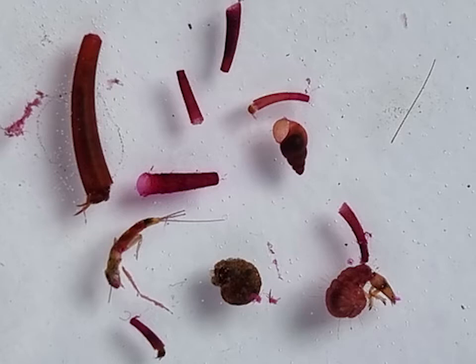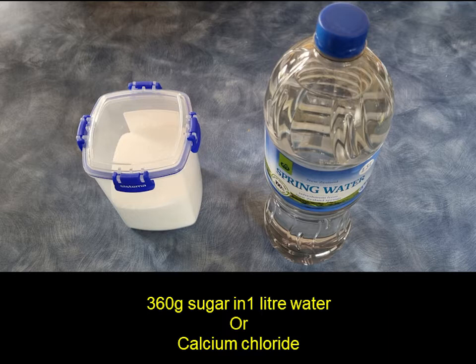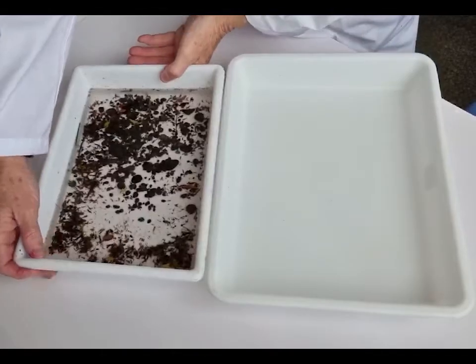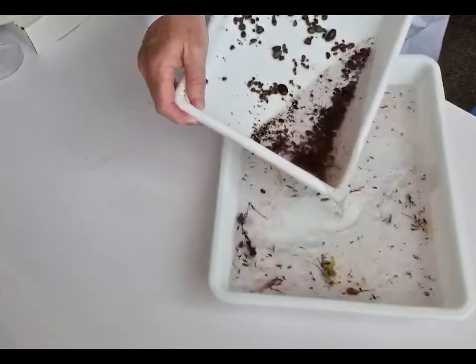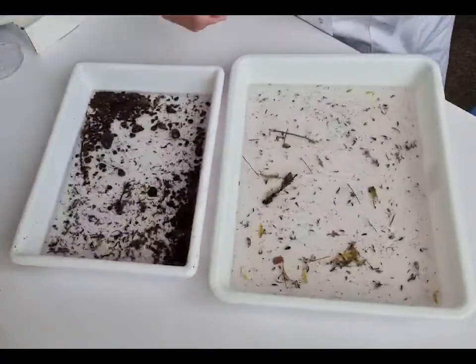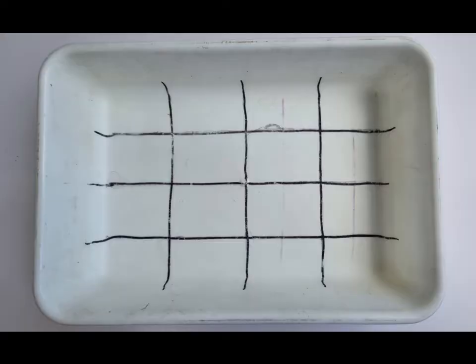Other methods you can use are things like sugar solution or calcium chloride — both of these techniques are designed to float animals. One method I quite like is simply elutriating them, in other words pouring off some of the top of the solution. You'll find that mayflies, stoneflies and these sorts of things float to one side, and then on the other side you end up with the heavier animals.